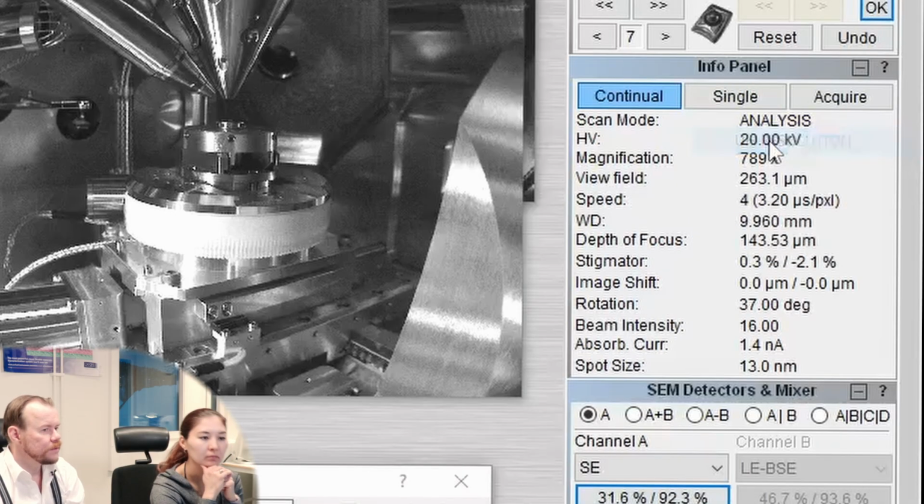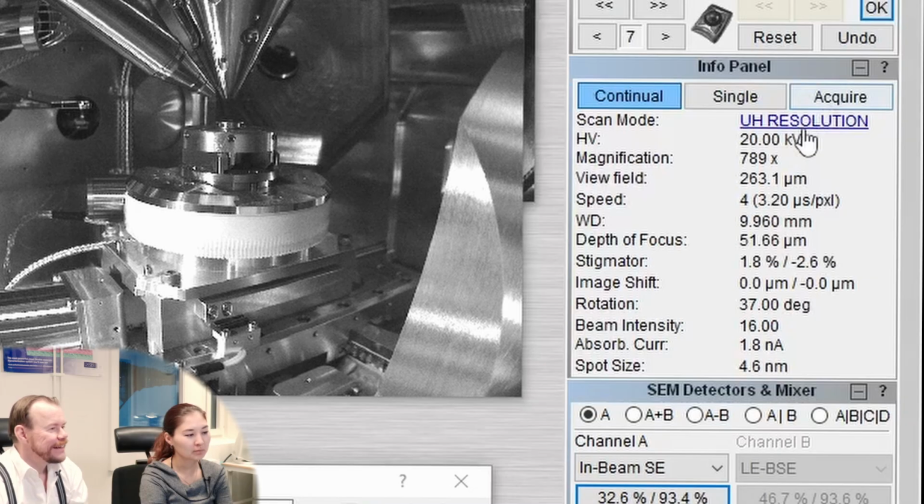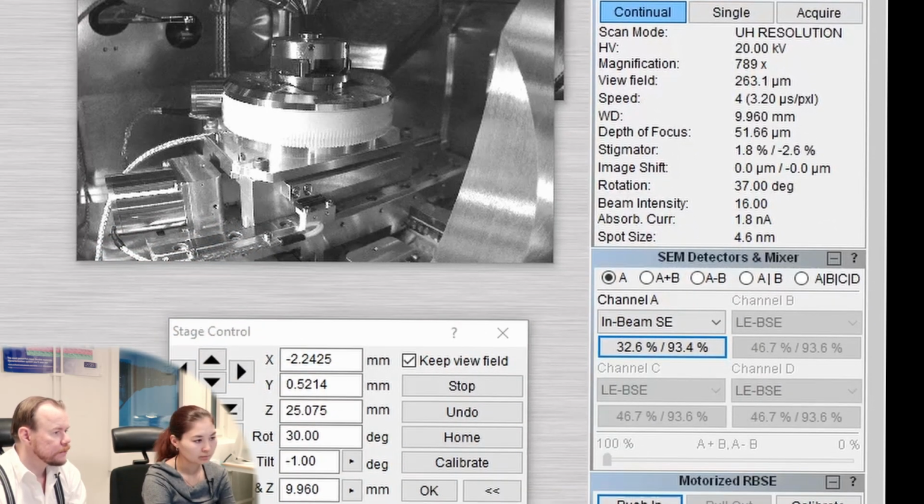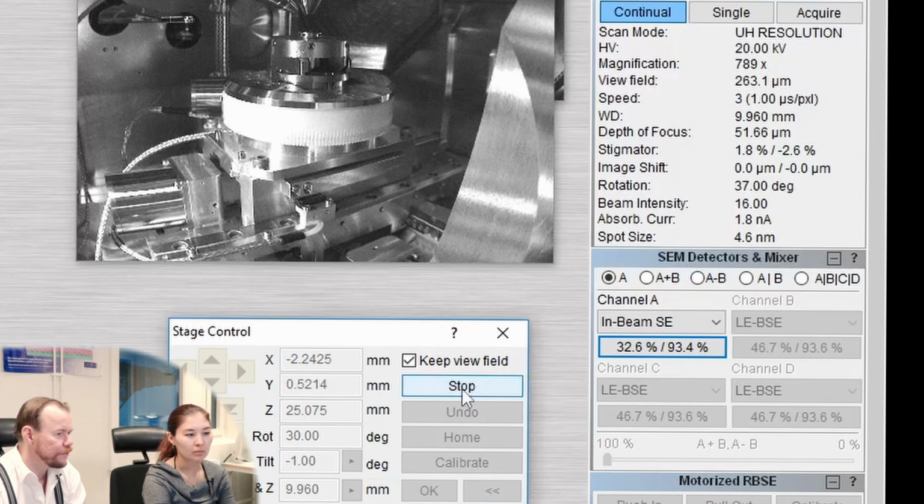So step one is to go to UH resolution, of course. So here is the UH resolution mode, and we are at 20 kV, and beam intensity is 16. Now the spot size shrunk to 4.6. So let's raise the stage a little bit, since we are going to use lower voltages over time here. Now we don't have any detector inserted, so it will be fine to go up to 5.